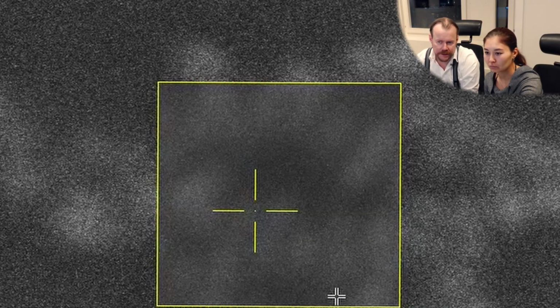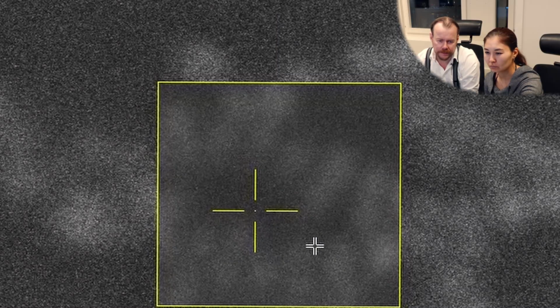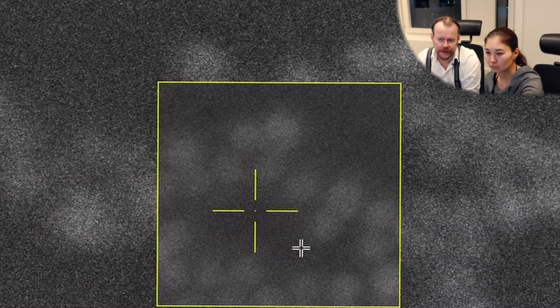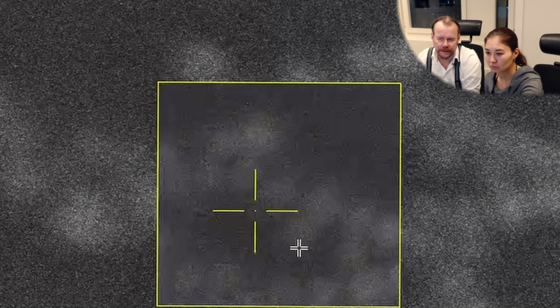Look on these particles you see here. Try to make them as sharp as possible. Mm-hmm. See, now they are pretty sharp. Try a little bit up and down now. A little bit down. There you go. Now a little bit left and right. Now go back a little bit. About there, right? Mm-hmm. And now you see, you can zoom in a little bit more. This is the max on the machine, 1 million magnification now.